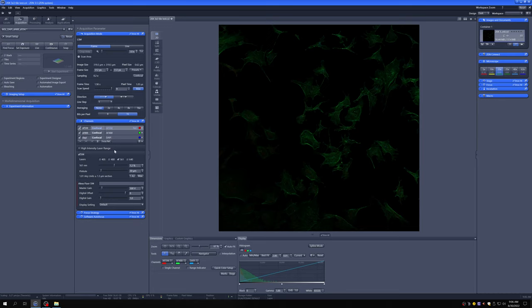If you are using a four-channel setting, if you hit 1AU for the longest wavelength dye, it will not usually adjust the other ones, and you need to copy this number and paste it into the other fluorophores.